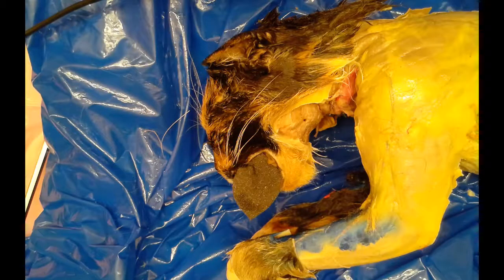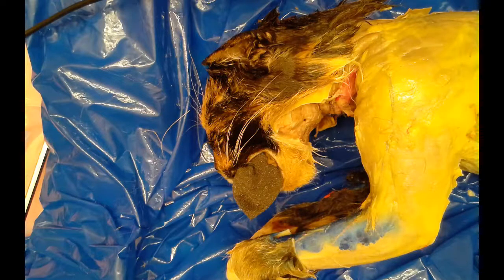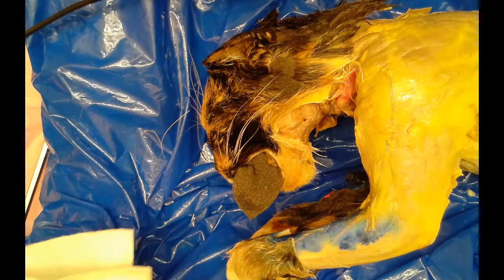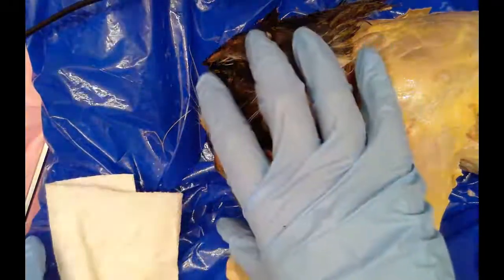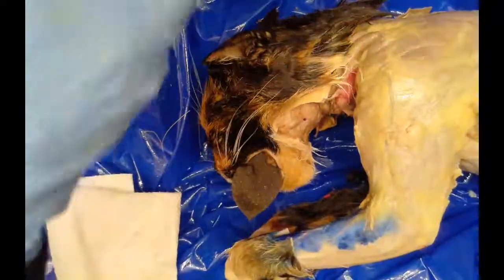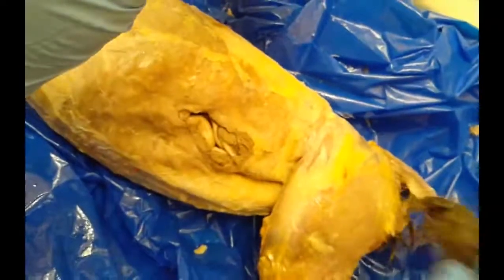This cat is a female. We're going to start off by identifying the key areas or parts of the body. This is obviously the head region, here's the neck, and if we move down a little bit further, this middle area would be the trunk. And then the end here would be the tail.